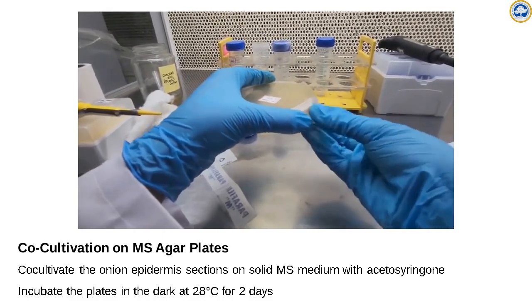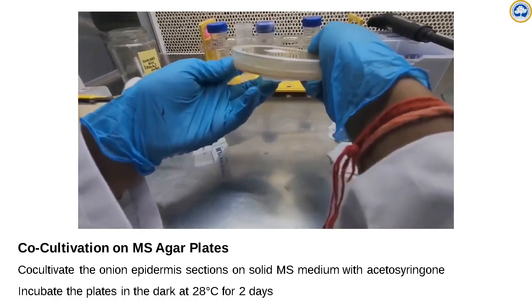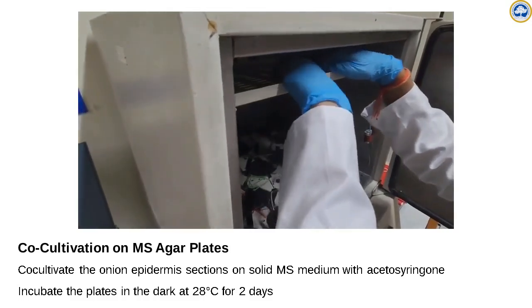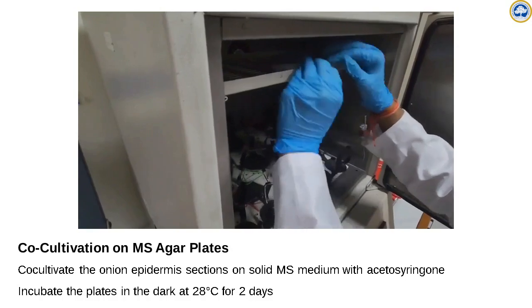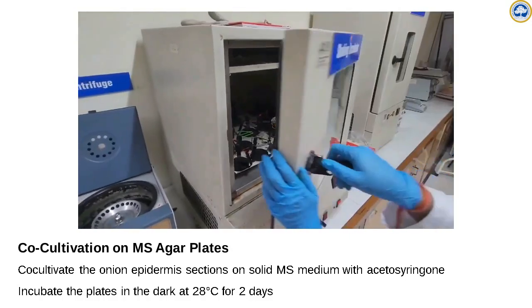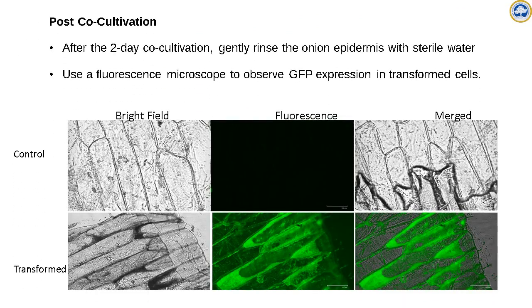Once the co-cultivated discs are ready, we pull them out of the plate and visualize the expression of the gene, or analyze the expression of the promoter, on a fluorescent microscope.